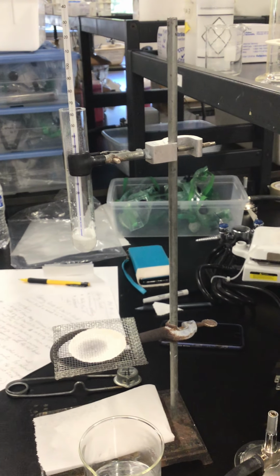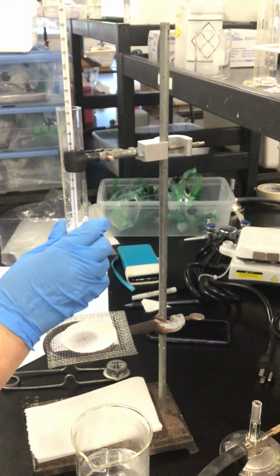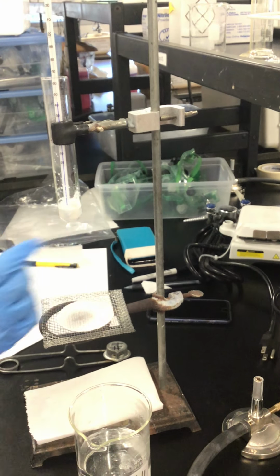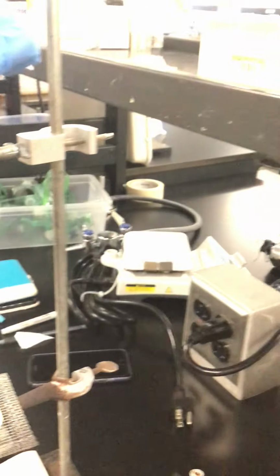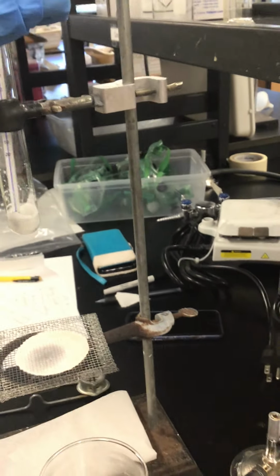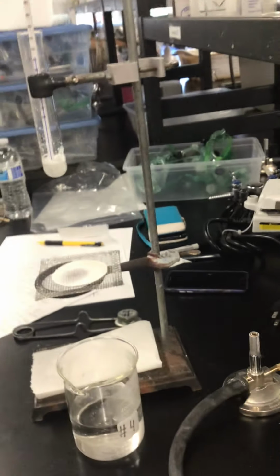It's supposed to drop a little bit when the sample solidified. It did solidify, all right. Yeah, because not all of it's solid yet, that's why. Let me guess, 42? Yes, this is 42.